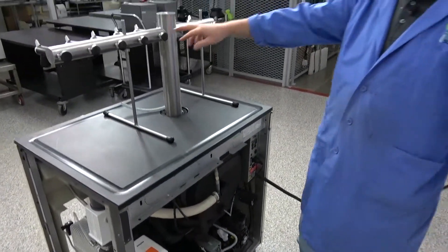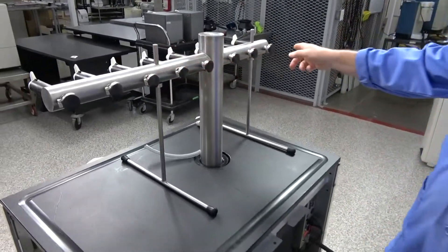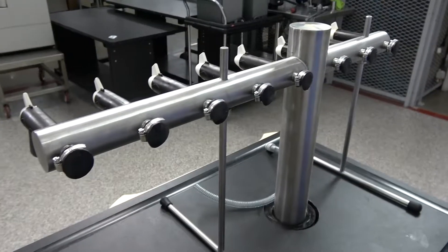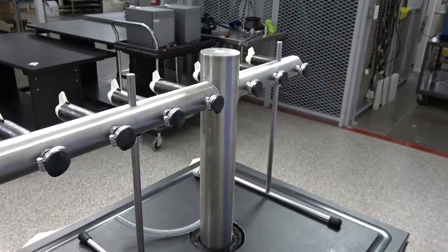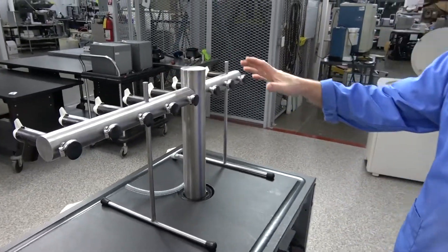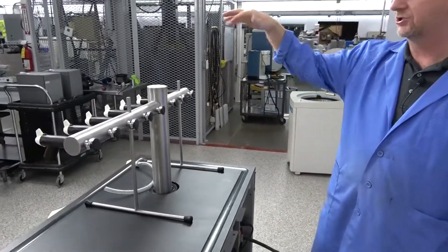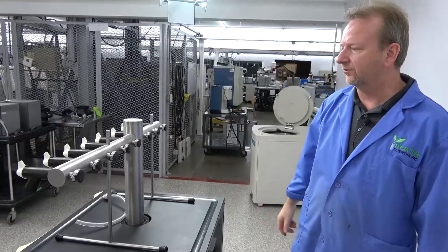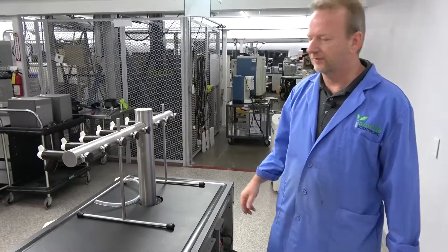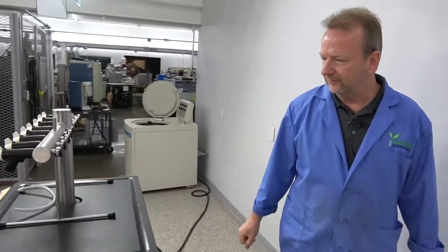But you can see on the back here, we've just got plugs on the back of the manifold here. So you can add another eight valves there so that you can have more port areas. But we also offer a huge tree I've got back here too that I believe it's a 48 port. So if you do need that, we would consider that too if you want to contact us about that one.